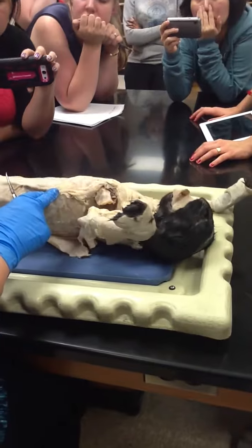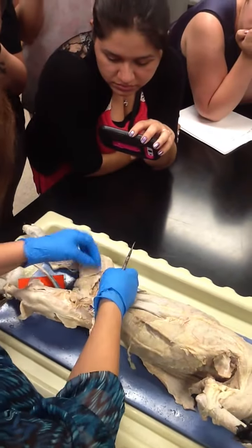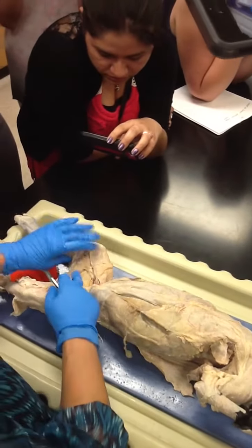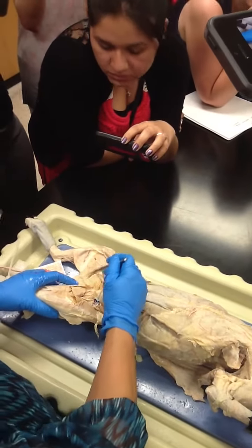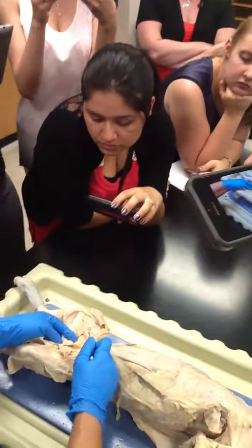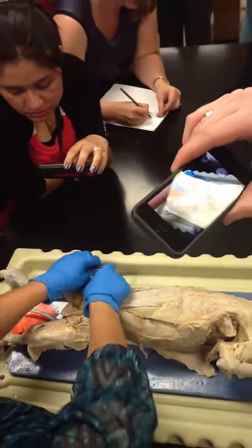Again, looking at the leg, the medial aspect, we have the gracilis, the lateral aspect, the sartorius. You open up the very first big muscle under the gracilis. This is the semimembranosus. The next big muscle is the adductor magnus or adductor femoris. The next muscle is the adductor longus.